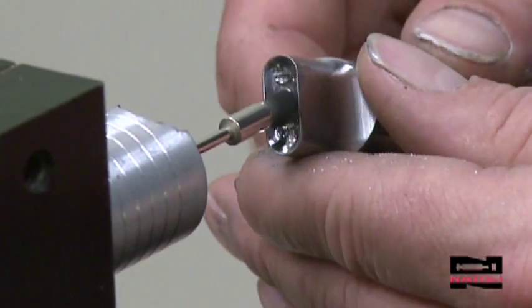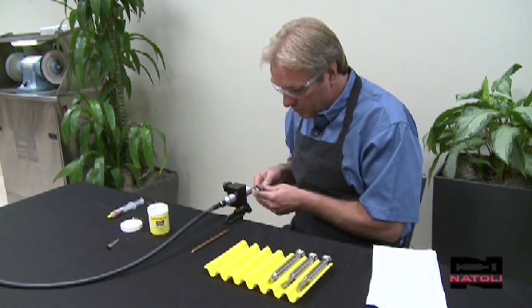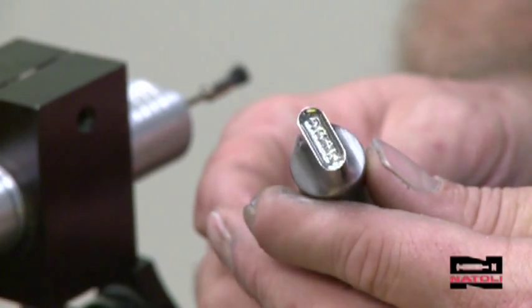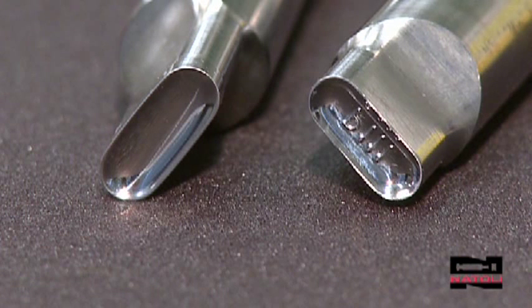The dental brush is primarily a polishing tool and a good one. Within a few moments, a dental brush teamed with polishing compound can restore your punch cups to a mirror finish and prevent sticking. It also enhances the surface finish of the tablet. The fine brush is used for finishing on punch cups and importantly can be used on plain or embossed tooling.